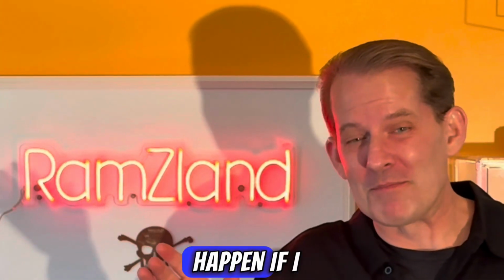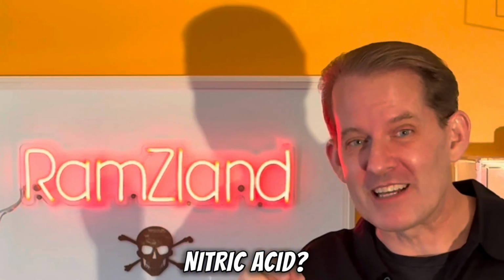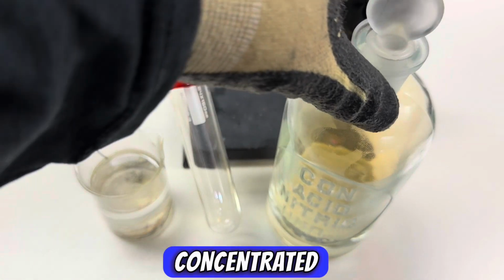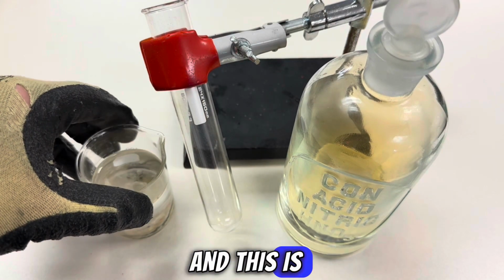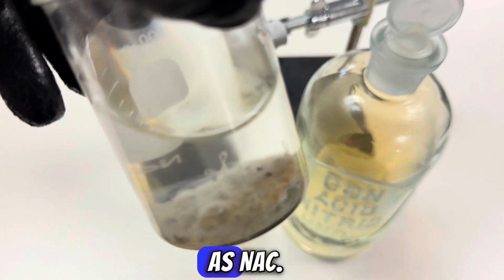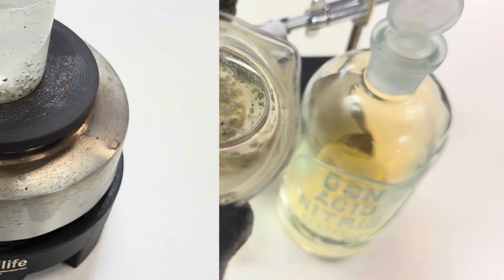What do you think will happen if I add my sodium-potassium alloy called NaK to concentrated nitric acid? Let's find out. For this redox reaction, we'll use concentrated 16 molar nitric acid. We'll use a test tube, a stand, and this is my sodium-potassium alloy. It's abbreviated as NaK. It's stored in mineral oil because it's so reactive even with moisture in the air.